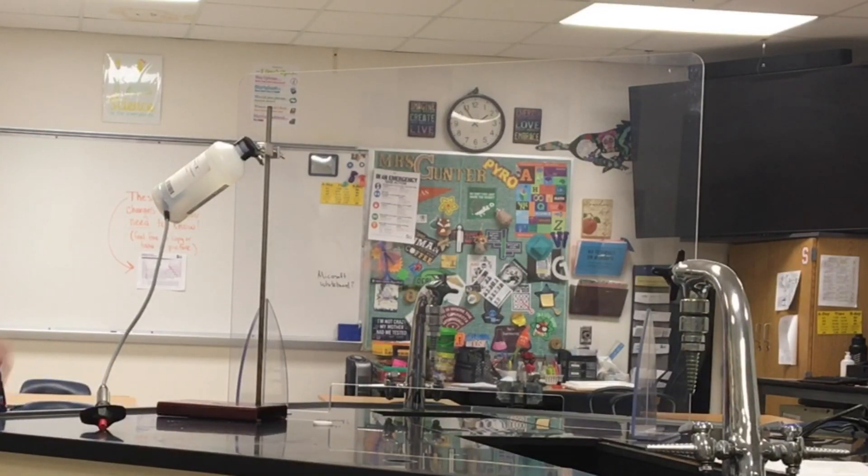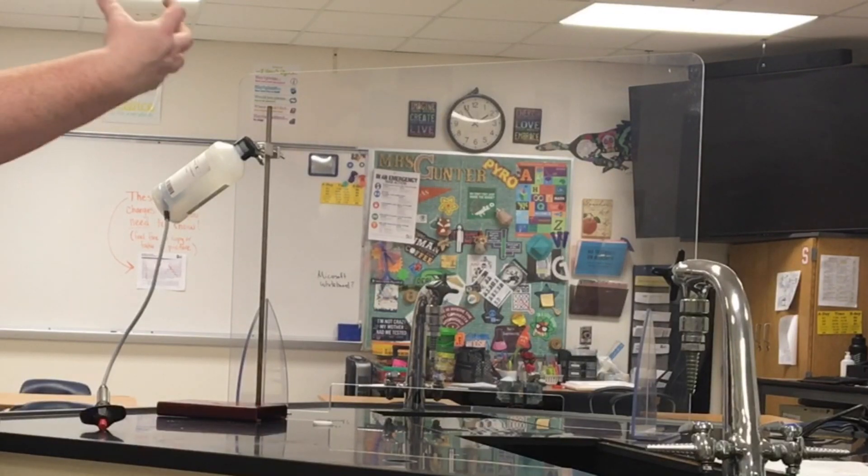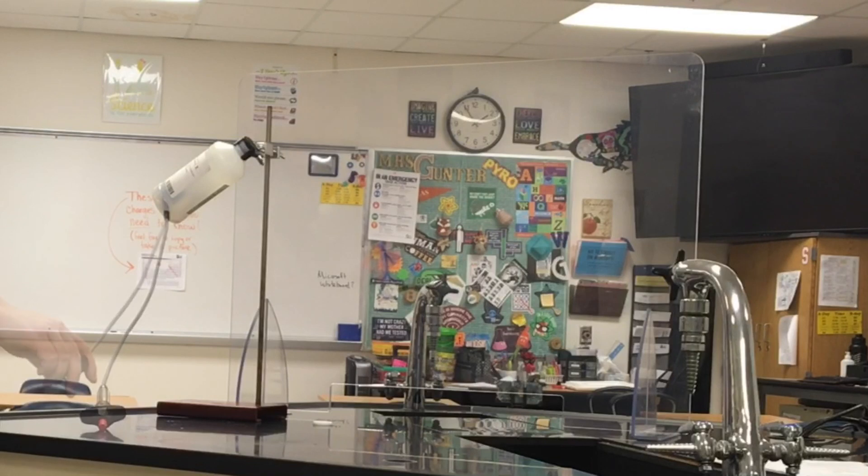So I am going to be able to cause this ignition to happen in an enclosed space, which is going to mean that it is going to have some slightly different effects on this reaction. We're going to go ahead and do this in three, two, one.